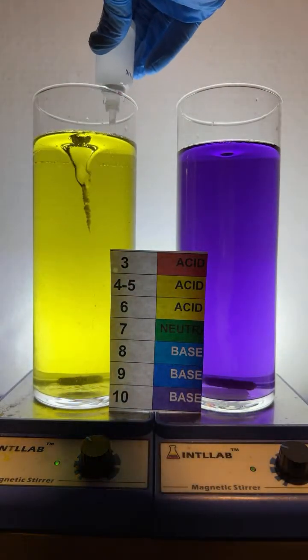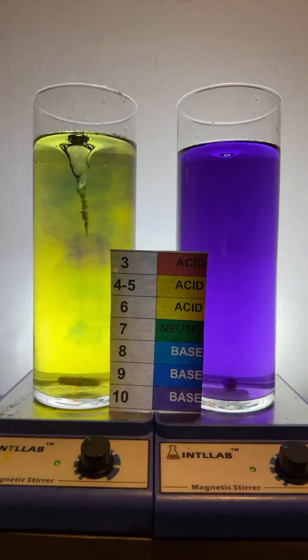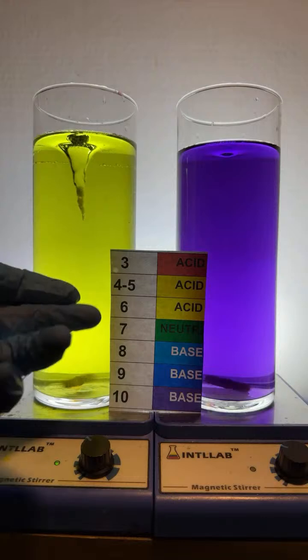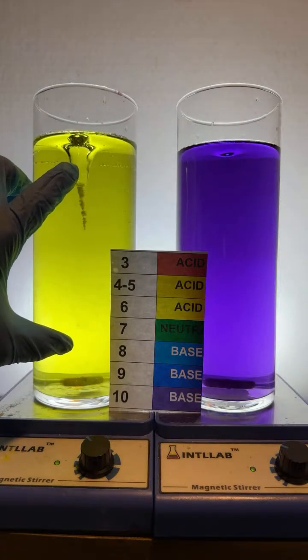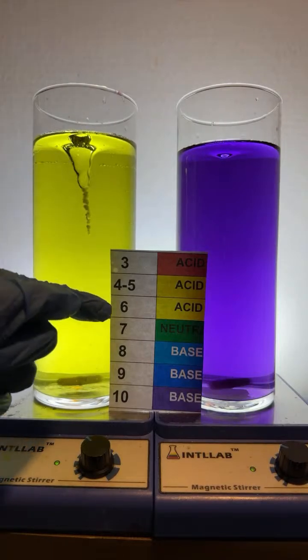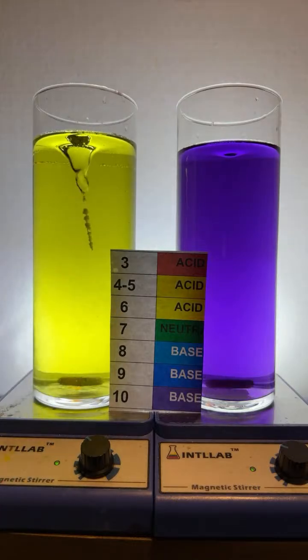Let's add, I don't know, 3 more drops. Watch it up here. 1, 2, 3 drops to the buffered system. And with those 3 drops, we're pretty much still pH 6. Now, what do you mean by a buffer crashing? What that would mean is if I add enough base to this that it reacts away all the acid that is in here, then the buffer will no longer stay at pH 6 and will start to move toward basic. That's what happened to your fish tank system.